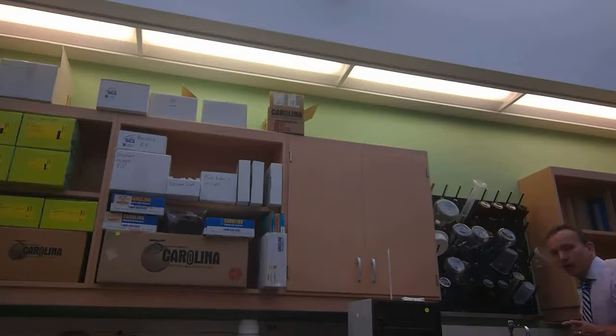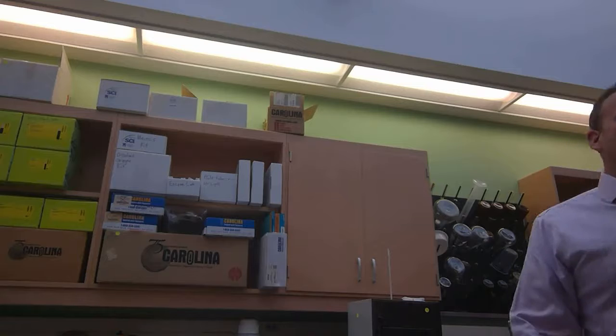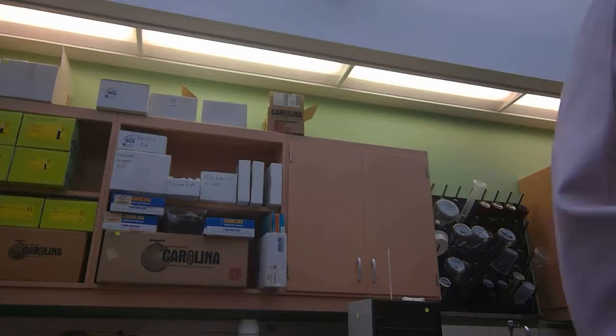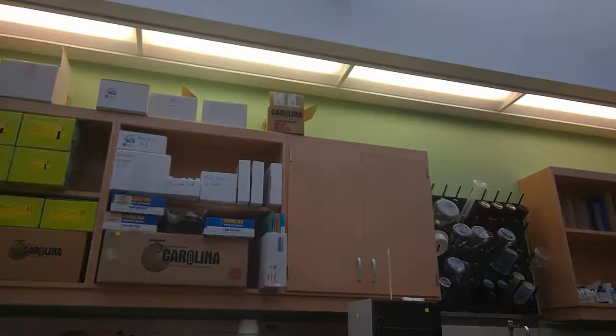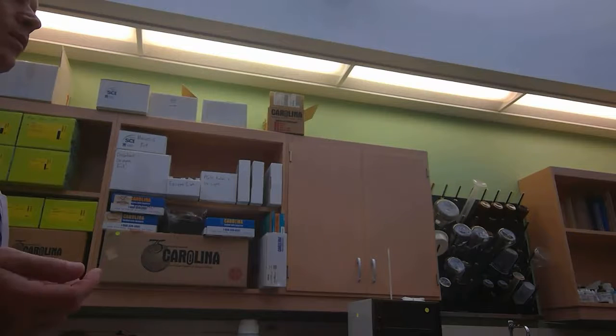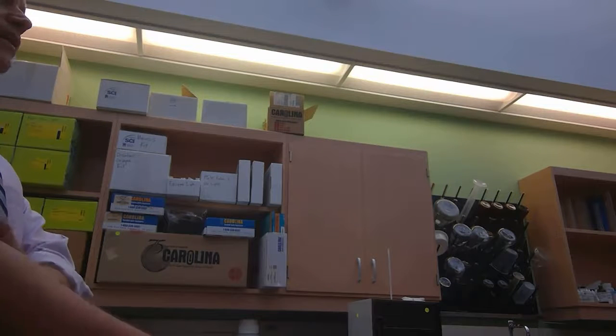Okay? Now I want to show you what will happen if you expose iodine to a polysaccharide. So what's something that we could use really quickly as a good indicator for being a polysaccharide? Look on the board there at our review and tell me what's an accessible polysaccharide.